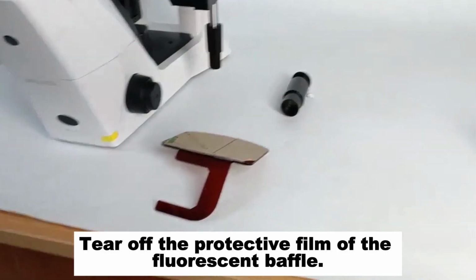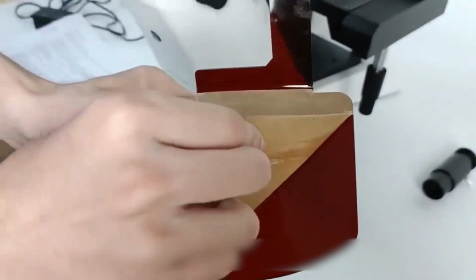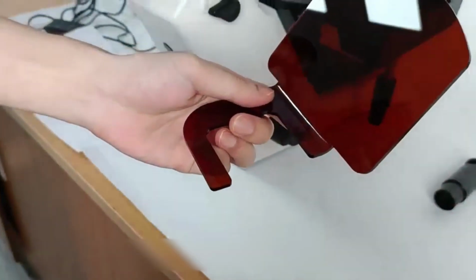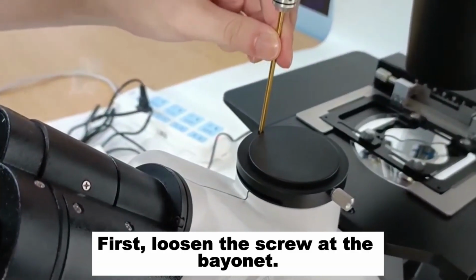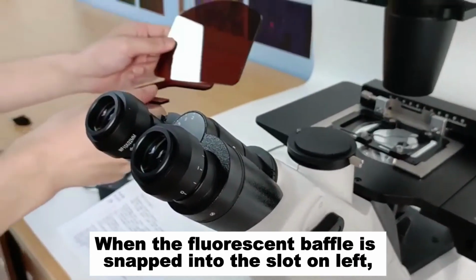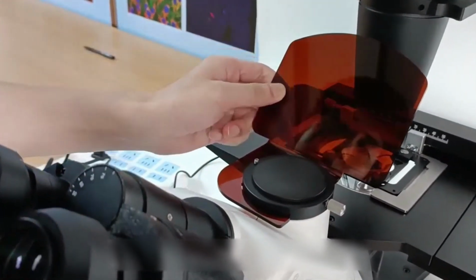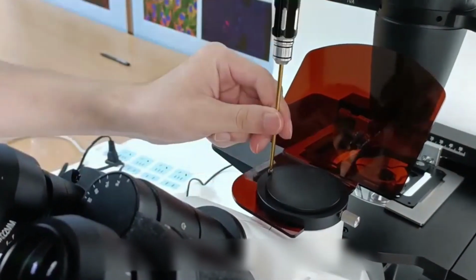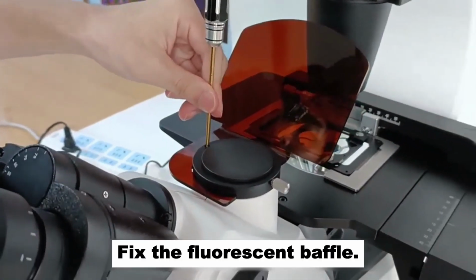Tear off the protective film of the fluorescent baffle. First, loosen the screw at the bayonet. When the fluorescent baffle is snapped into the slot on the left, tighten the screw. Fix the fluorescent baffle.